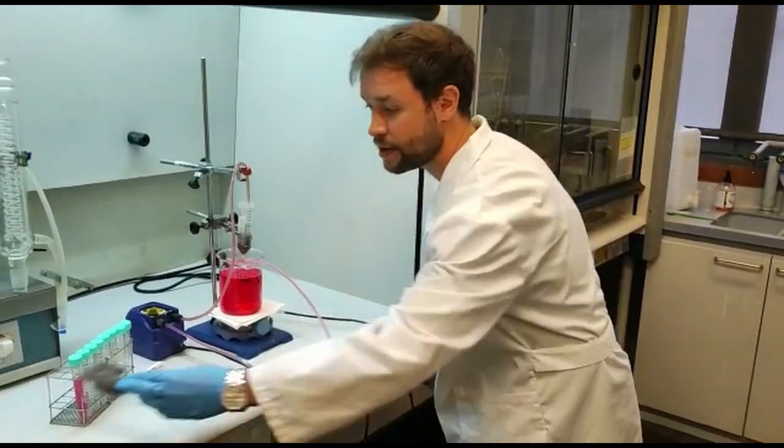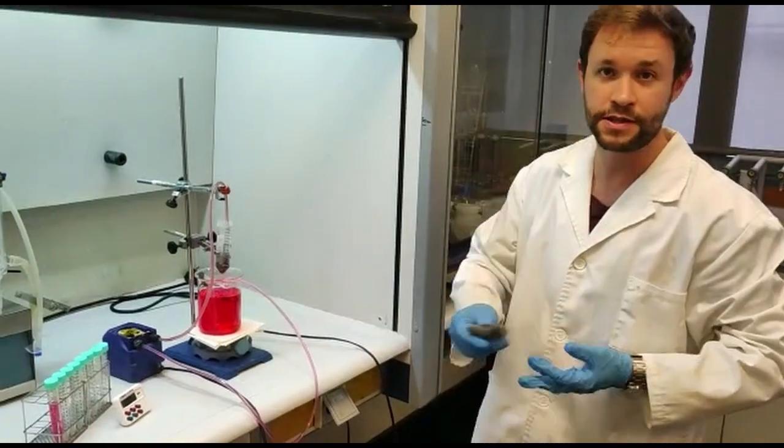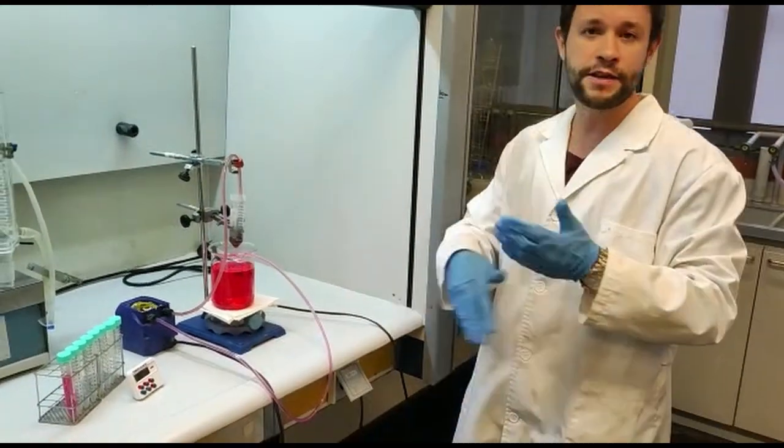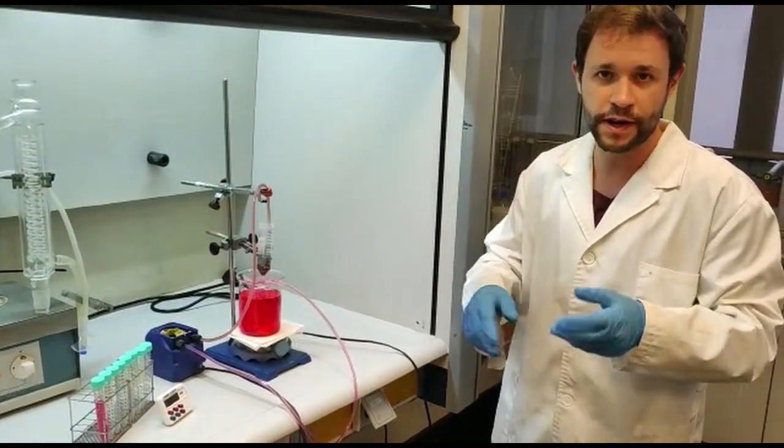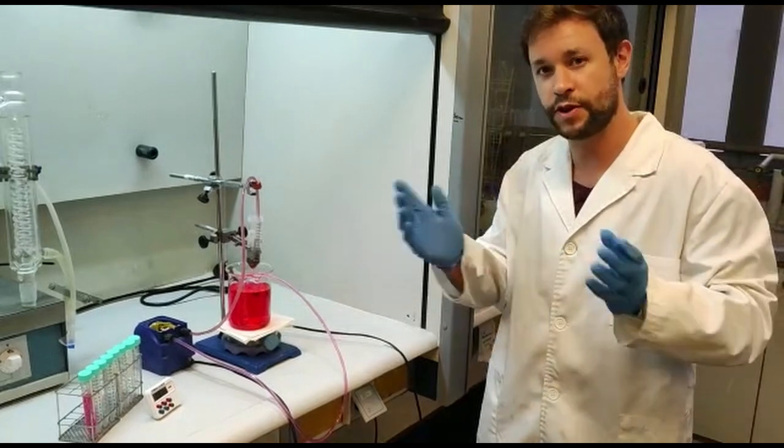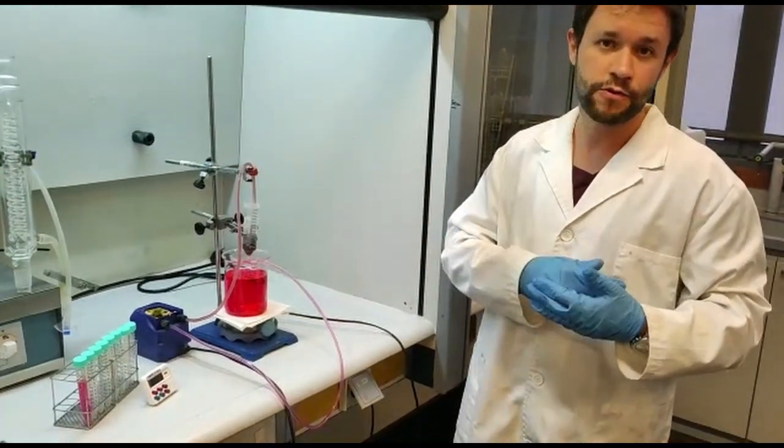We're using zero-valent iron in the form of commercial steel wool, which you can find everywhere. This simulates the zero-valent iron nanoparticles or microparticles that we can employ, which are extremely reactive.